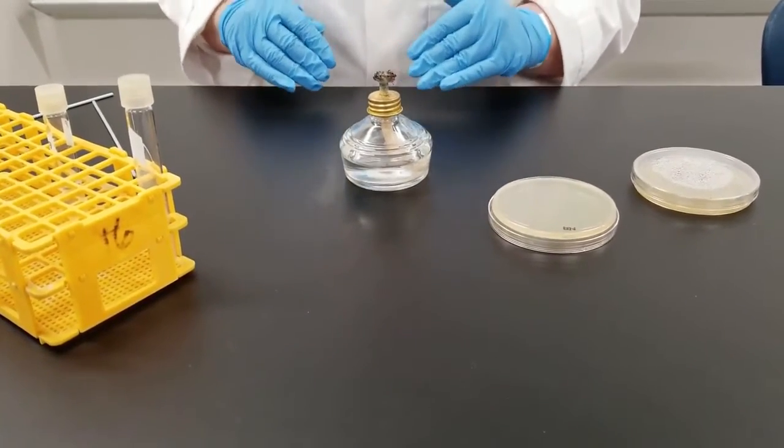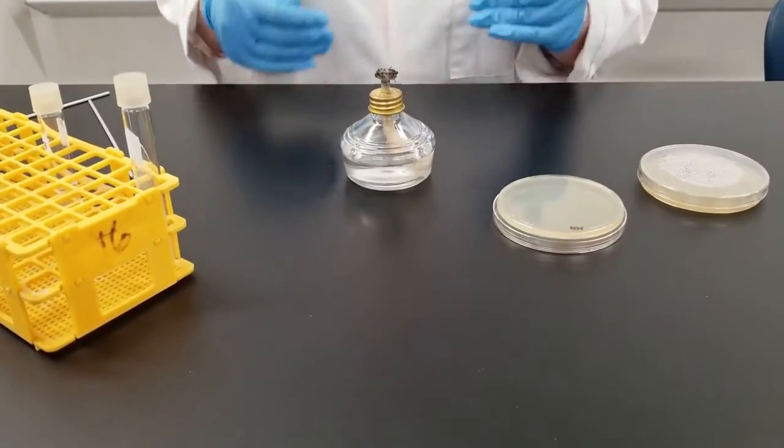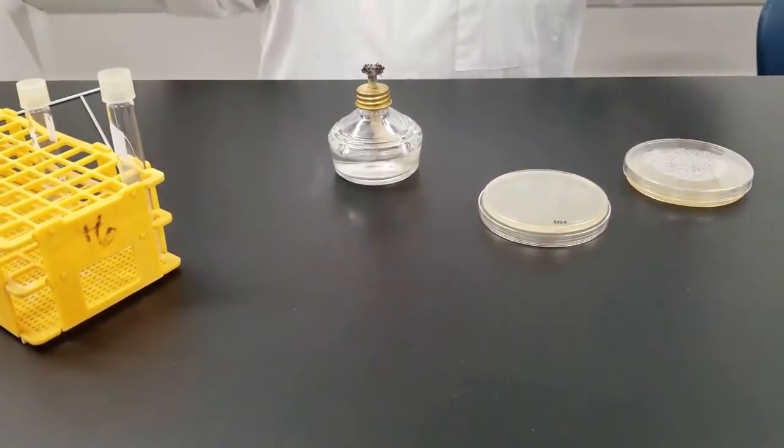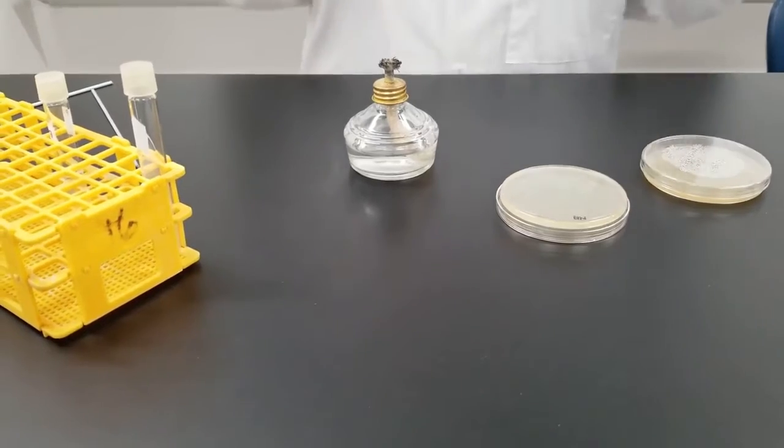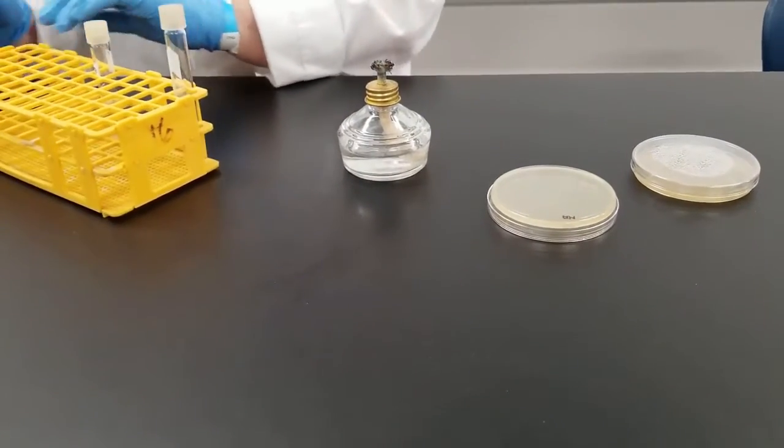So whenever you open a petri dish, open a tube, you want to be within that range so that you don't get contamination from the air or someone walking by. So you always want to be working in that closed area.